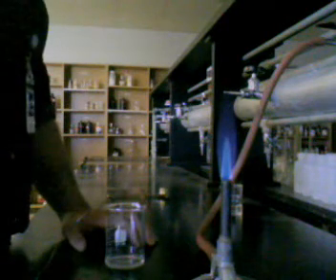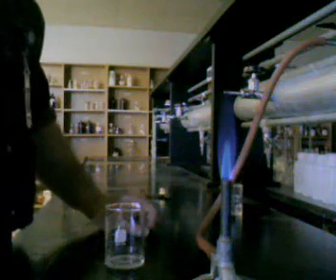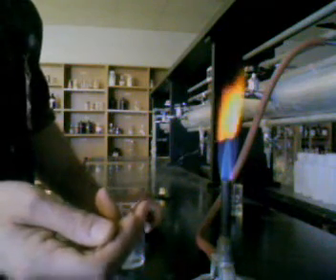And if you happen to use a glass stirring rod, you'll see that too, because glass contains a lot of sodium in it. So if you're using a glass stirring rod, what you need to look for is the initial burst of color. Anything after that, as you heat up the glass, will result in an orange sodium flame, like this.